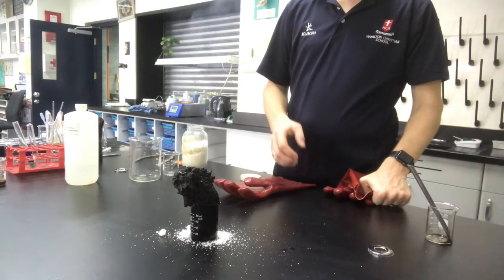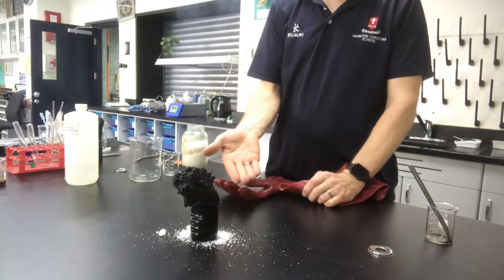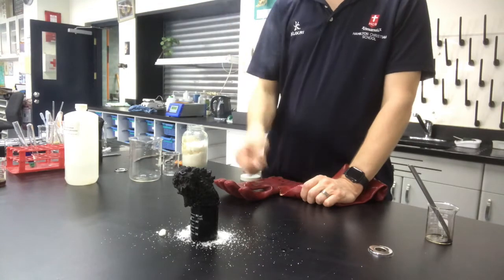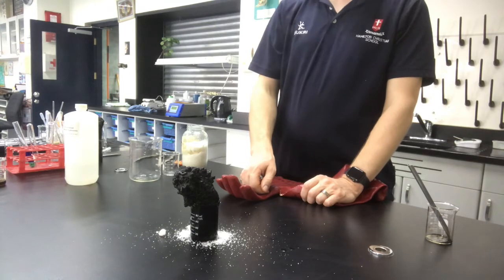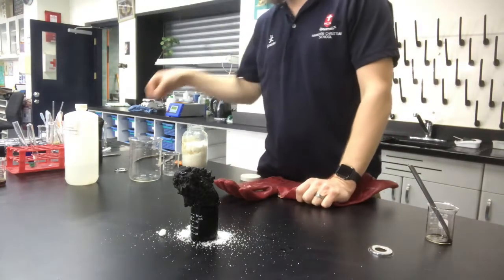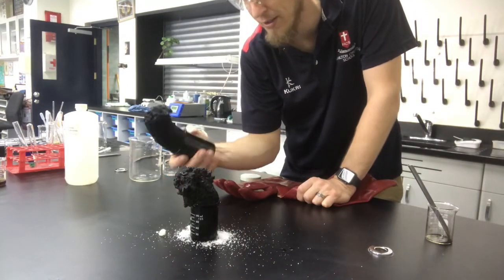But again, you can see, because I spilled sugar everywhere, the original colour of the sugar was this white, and now we have black, and we've got heat coming off. That smoke is steam, and probably a little bit of burnt carbon as well. But yeah, that's quite cool. That one didn't quite work as well as my practice one, so here's my practice one, which made this cool tube. This one doesn't quite look as funky.